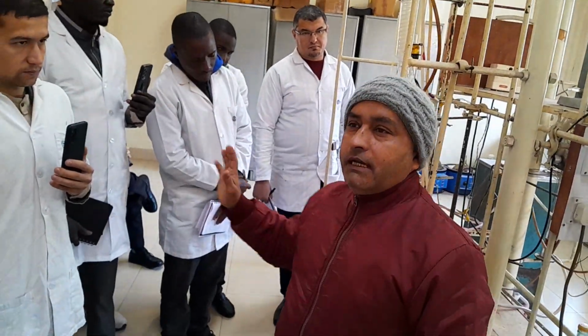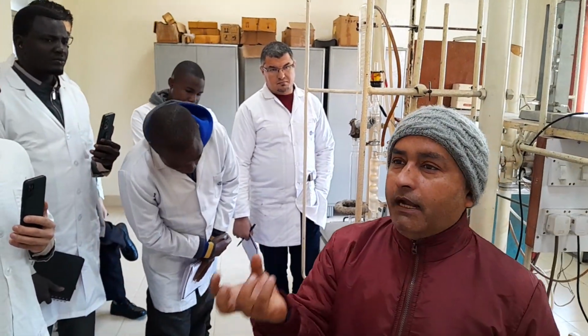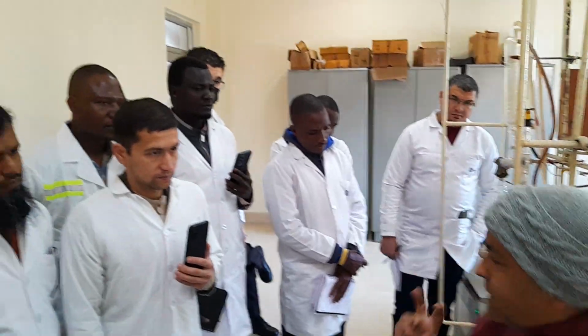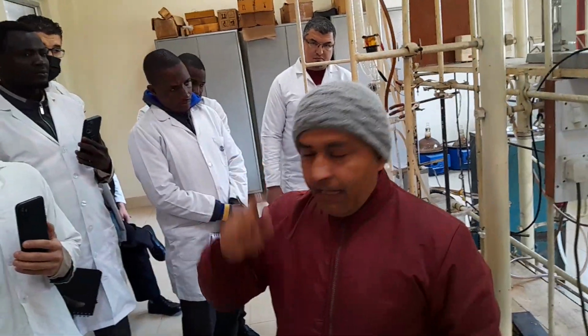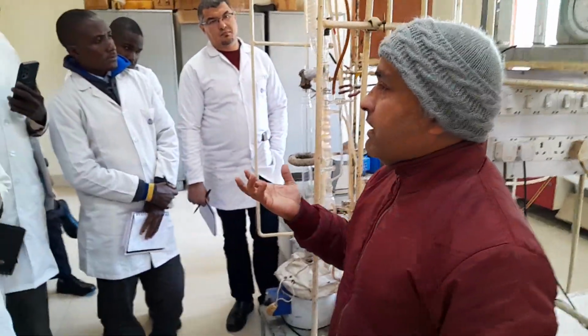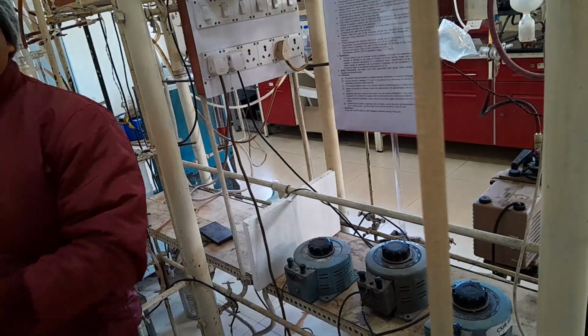Now your crude oil is ready for the distillation process. Your dry crude oil is ready for the distillation, because when you are doing fractional distillation, your crude oil should be dry in nature. Okay, and the second thing which is very, very important is the method by which I am doing the distillation process. As we know, distillation is a process by which we can separate or segregate different boiling point compounds according to their boiling point. Because crude oil has different boiling point compounds, it has to be distilled by fractional distillation.